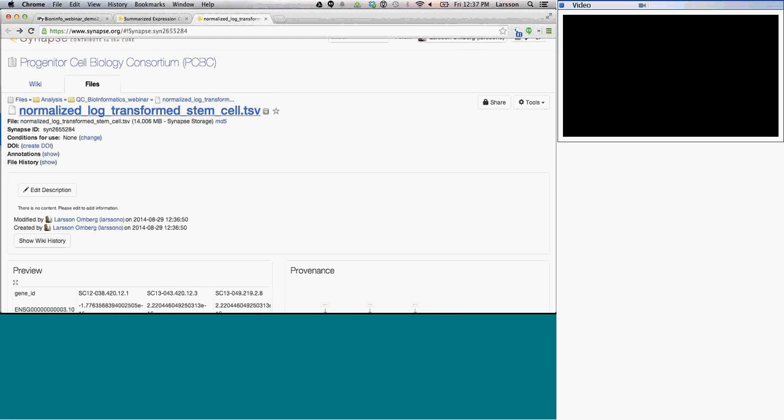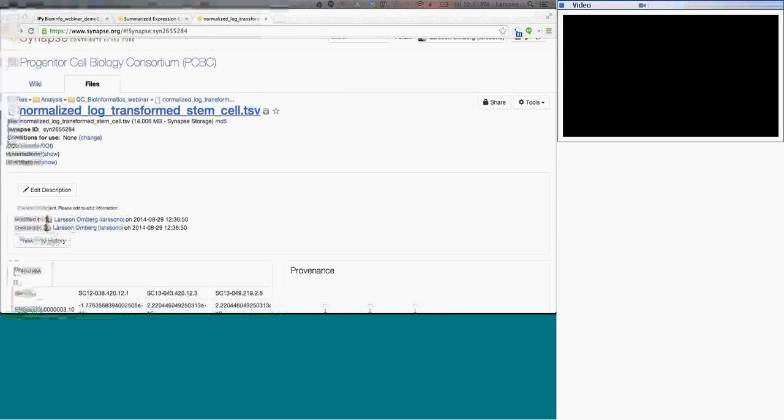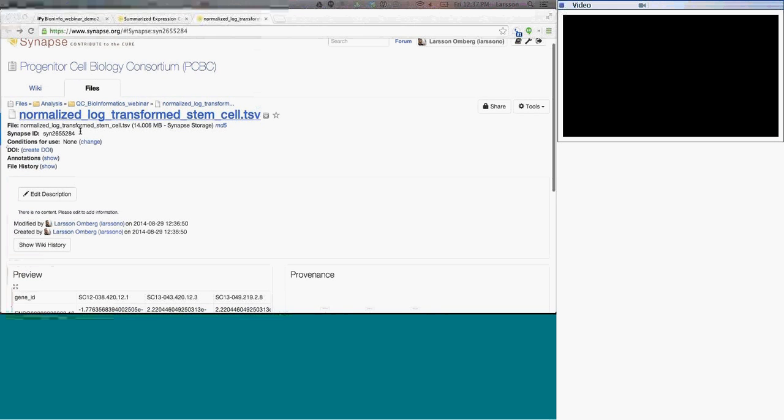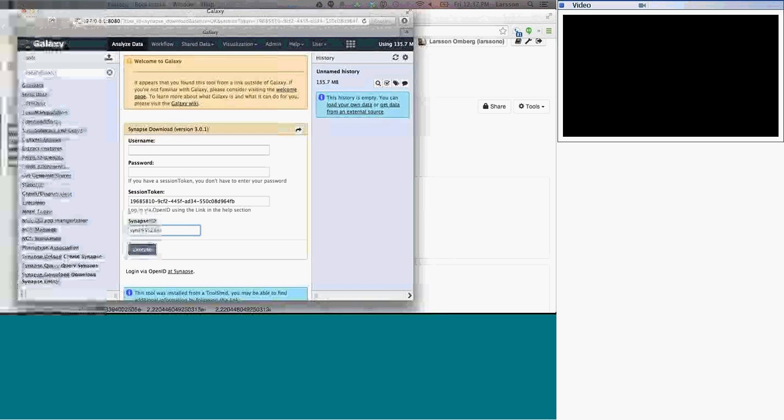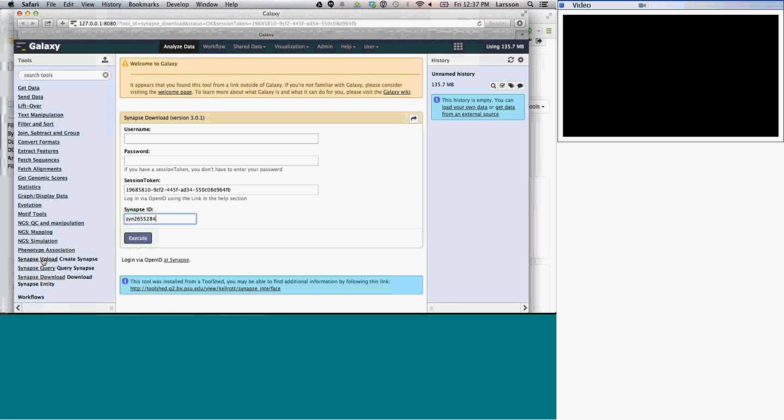The last thing I'm going to show, which has come up by request, is how you work with Synapse outside of, for example, Python or R. We do have interfaces, so you can download things directly into Galaxy. If you would prefer to do this kind of analysis in Galaxy, before I do that, I'm going to take the SynID of this normalized data and copy it, and go over to a Galaxy instance. This is a Galaxy instance I'm running on my own machine, and you can install a Synapse interface through the tool shed.